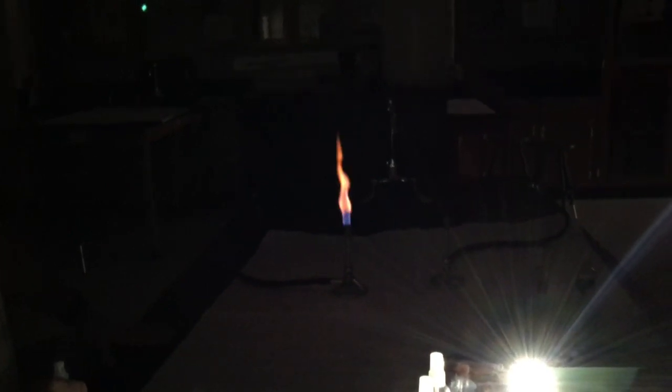Did I notice that your flame is a little hot and crazy, Mr. Scott? How can we adjust the Bunsen burner so we see that awesome double cone? Yeah, I think I got some residue left over from the last spray here, but that's a little bit better here. If I wanted to open the barrel, that's going to allow more oxygen in, so that way I get that double cone blue. See, I'm getting a little residue left over, but up here I'm not seeing as much. So I'm going to try this up here.